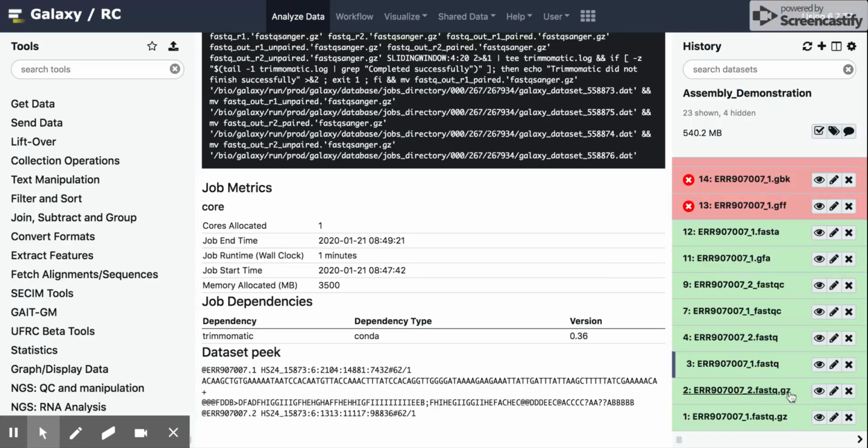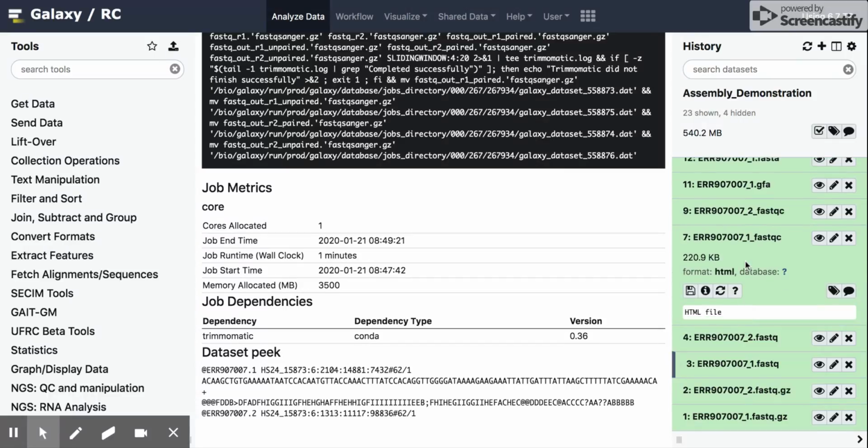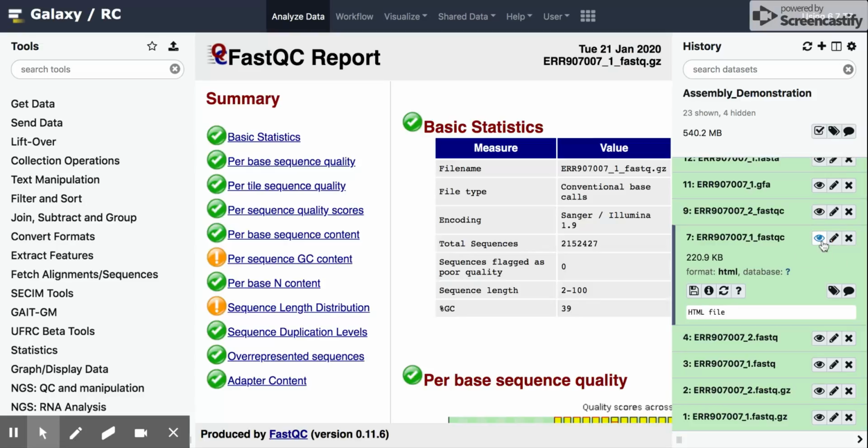If we continue on, we see that there's FastQC run on both the trimmed forward and reverse reads. In a separate video, I'll go a little more in detail with what this analysis looks like and how you can use it to triage your reads. But if we want to click on it quickly, we can use this little eye icon here.